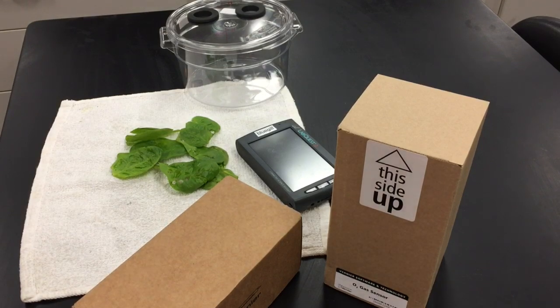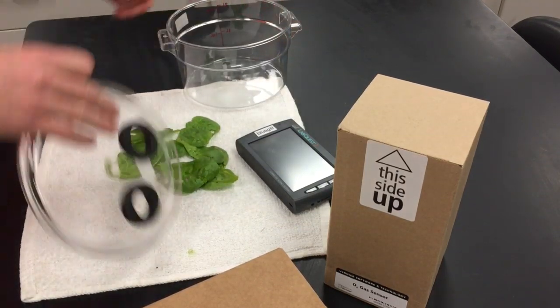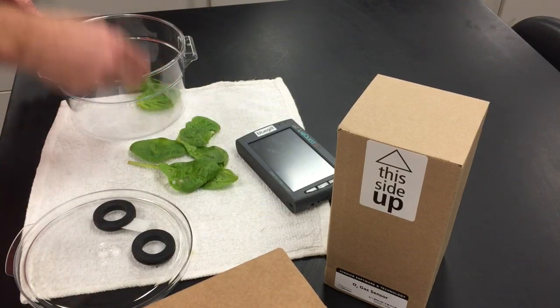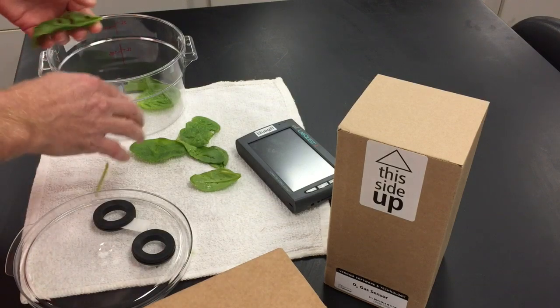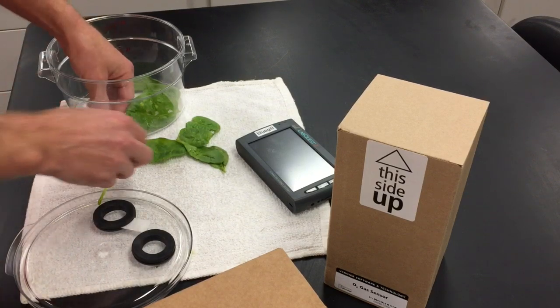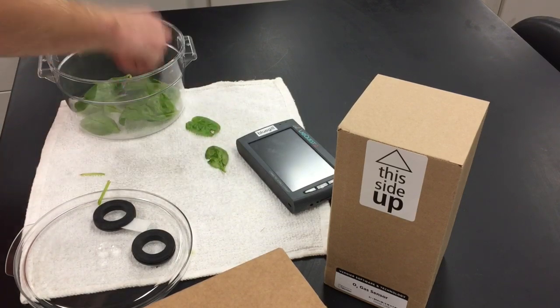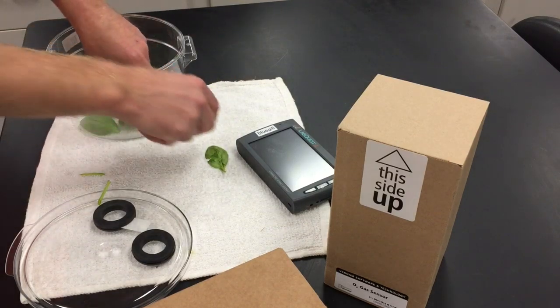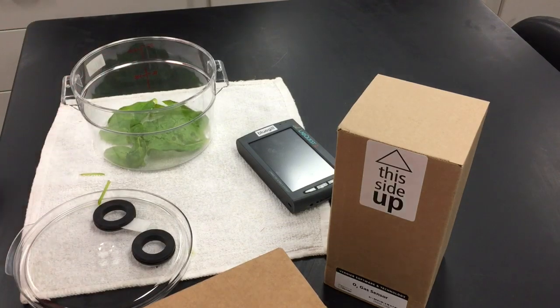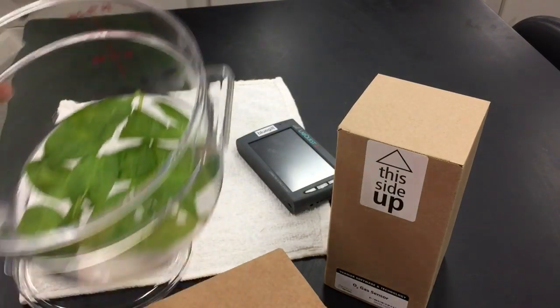Here is the setup. You're going to obtain enough spinach leaves to cover the bottom of the chamber — just place those in there. If there's a lot of extra stem you can remove that, it's not needed. You're lining the bottom without stacking the leaves one on top of the other. I used about eight spinach leaves.